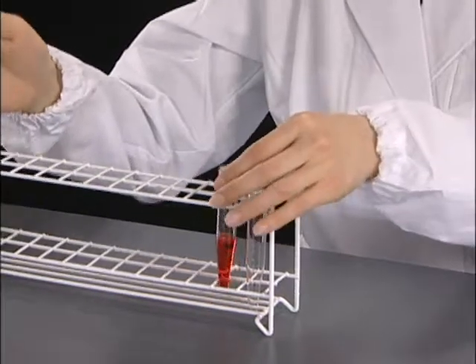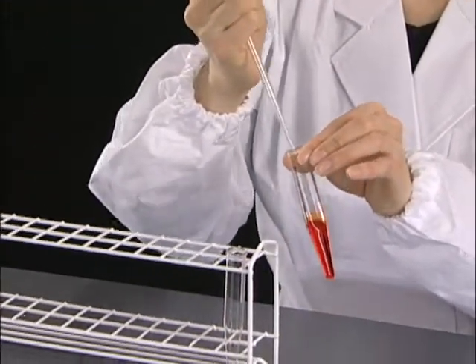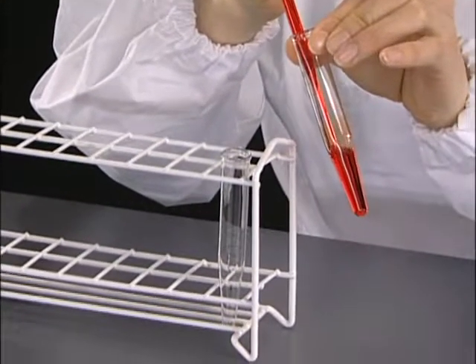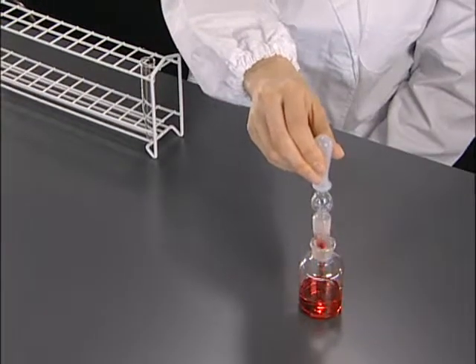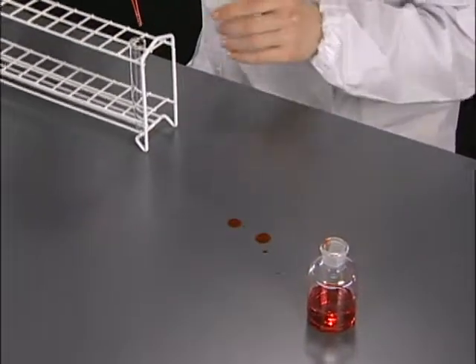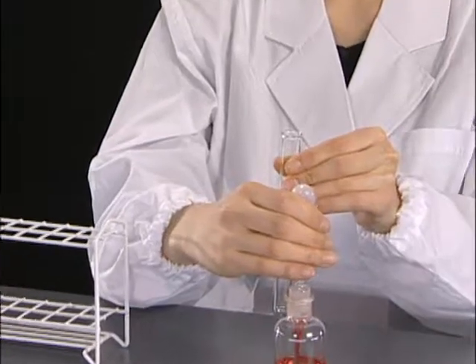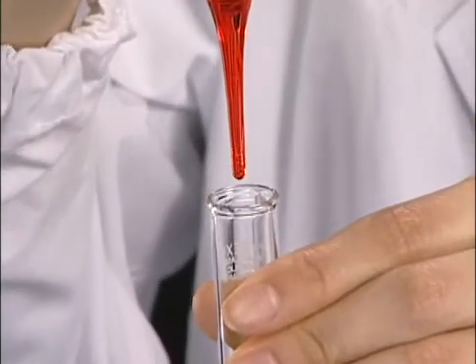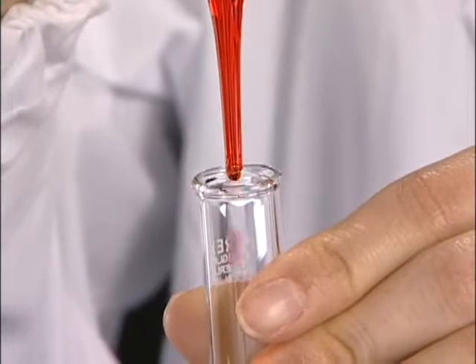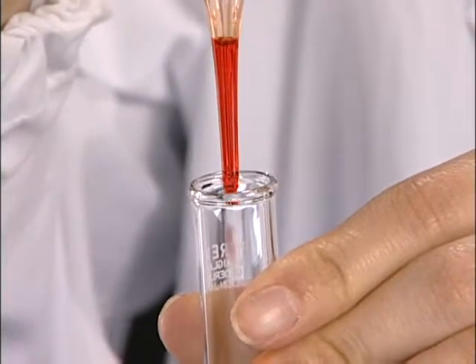When you transfer a liquid from one container to another, place the two containers as near as possible. If the containers are far apart, you may accidentally drop the reagent. In order to prevent the contamination of a transfer pipette, add liquid from just above the mouth of the container.